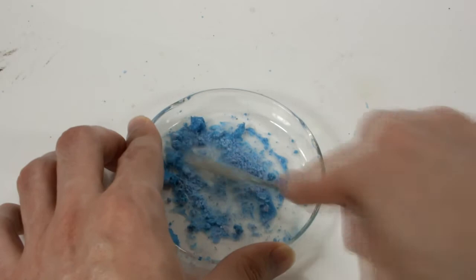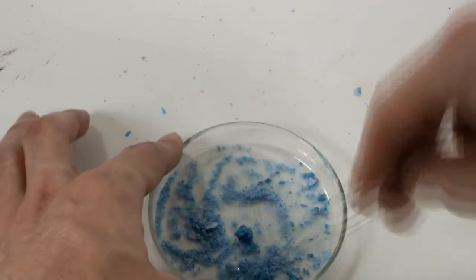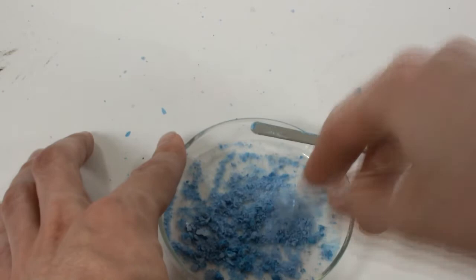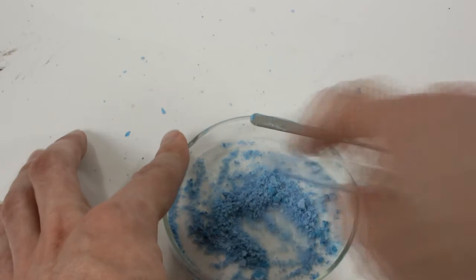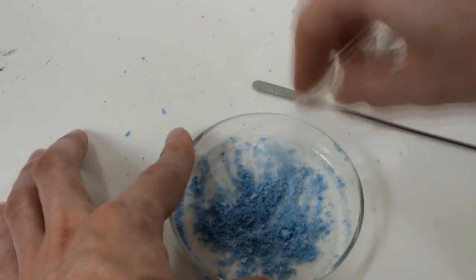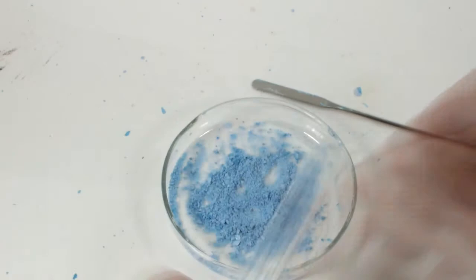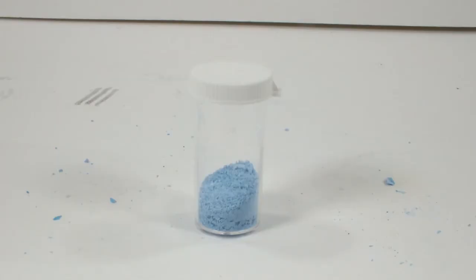Here we have the mostly dry sulfate complex after drying overnight, and it has this nice powder blue color. It doesn't seem like the fact that it was darkening was a big deal. I was only planning on looking at the product, not doing all this grinding when I did it, and that's why I'm not wearing any gloves. But I should be, because nickel compounds are at least slightly toxic, and they have been implicated as carcinogens. Rest assured, I'll be washing my hands thoroughly. The good news is the more I grind it, the better it looks. The final yield is 2.36 grams, which is an amazing 90%, so I'm extremely happy with this product.